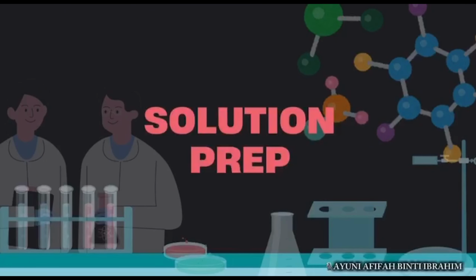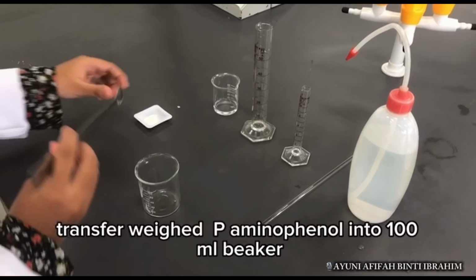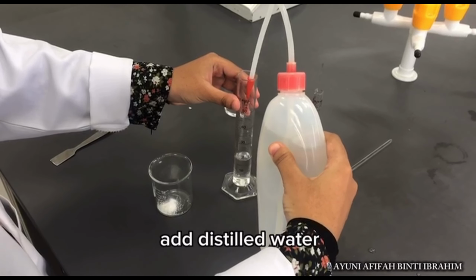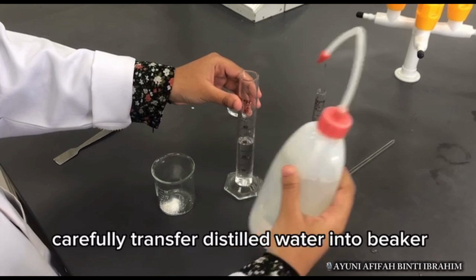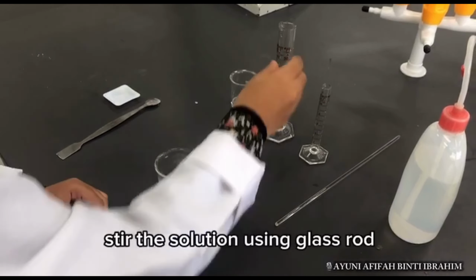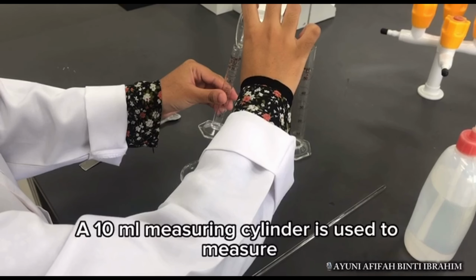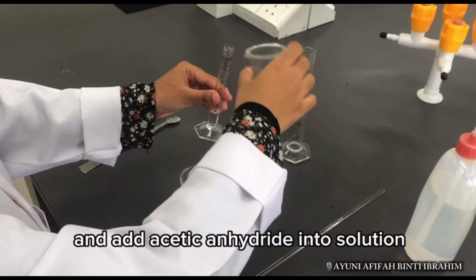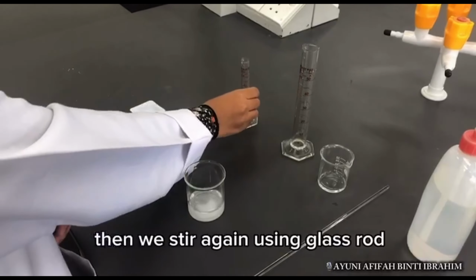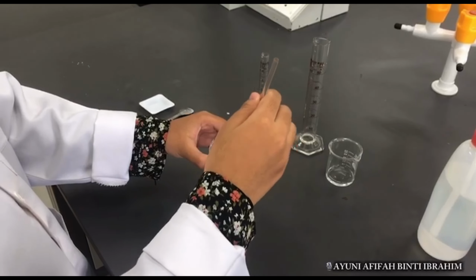Step number 2, solution prep. Transfer weighed p-aminophenol into 100 ml beaker. Using measuring cylinder, add distilled water. Carefully transfer distilled water into beaker containing p-aminophenol. Stir the solution using glass rod. A 10 ml measuring cylinder is used to measure and add acetic anhydride into solution. Then we stir again using glass rod until we get cloudy solution.